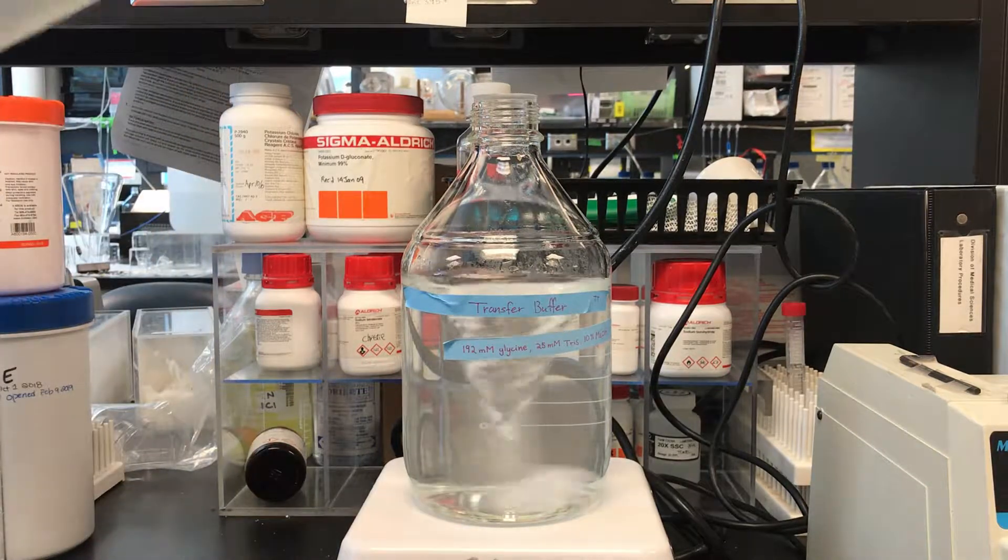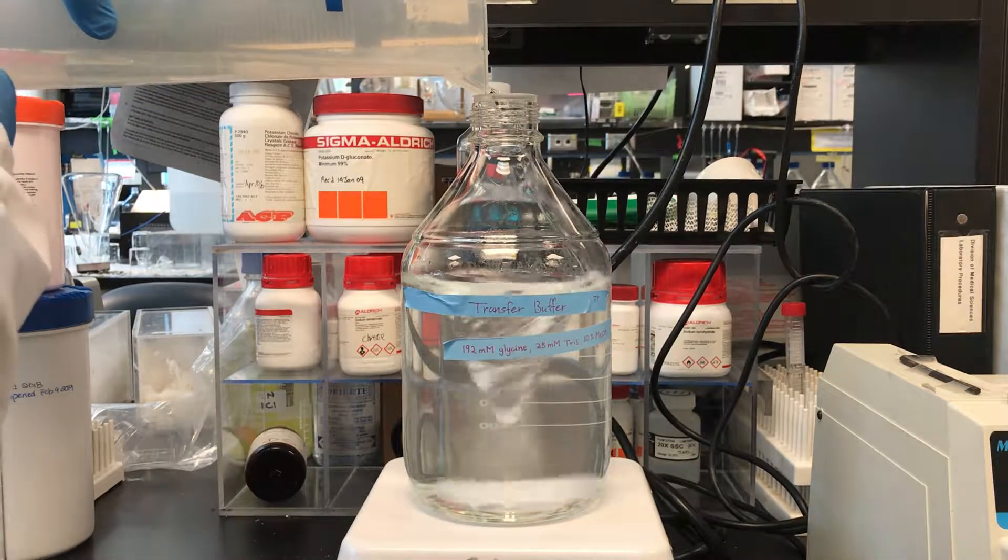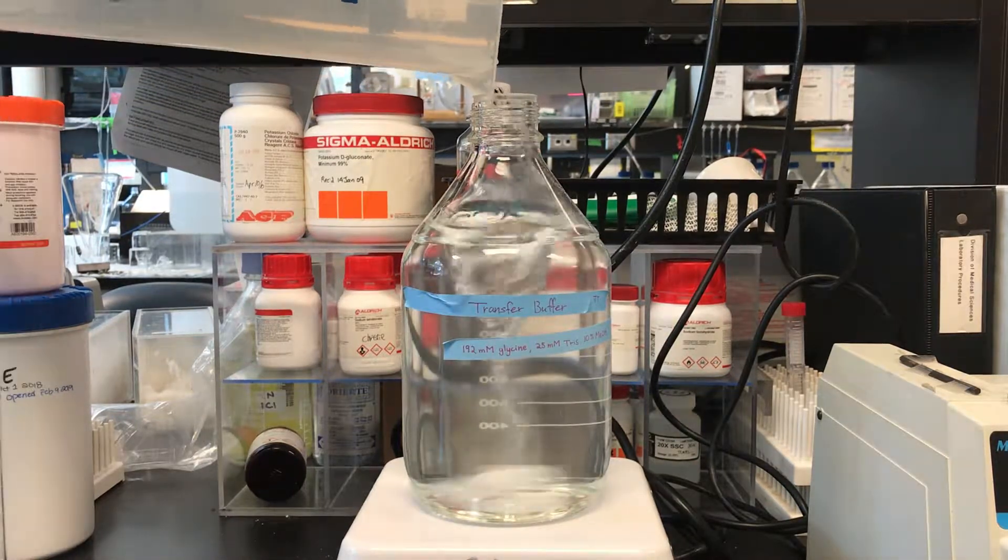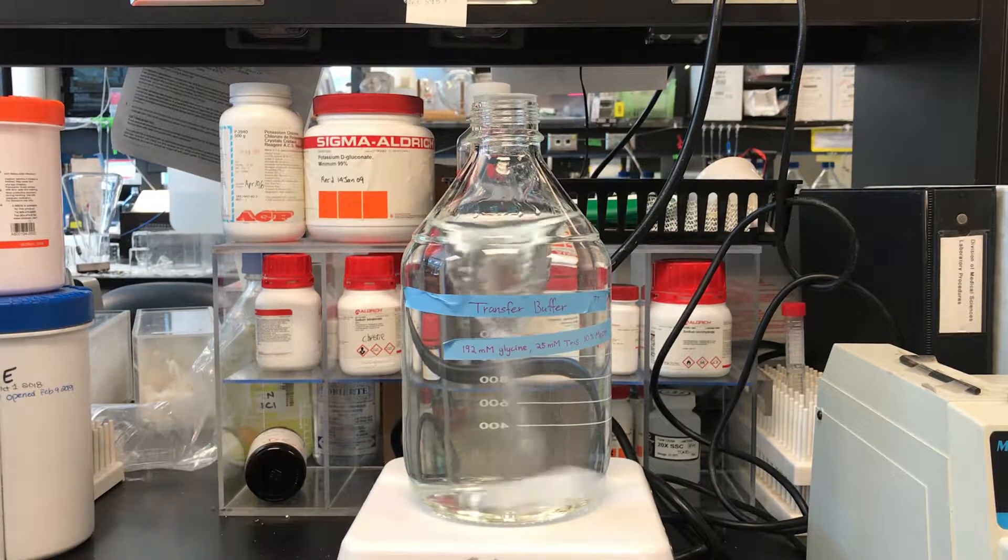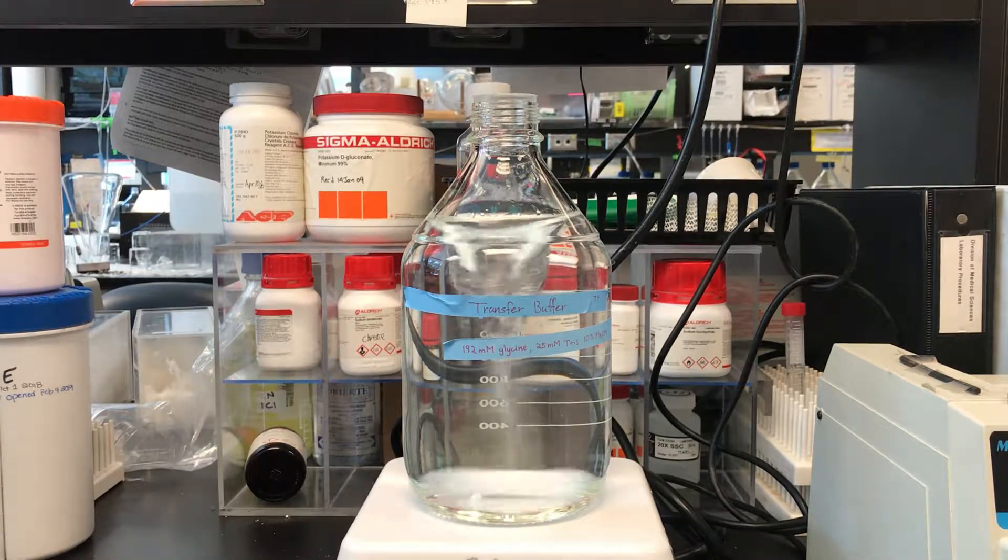Next, add the remaining distilled water and wait until all chemicals in the buffer bottle are clear.